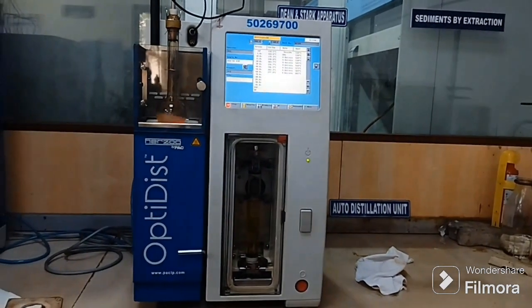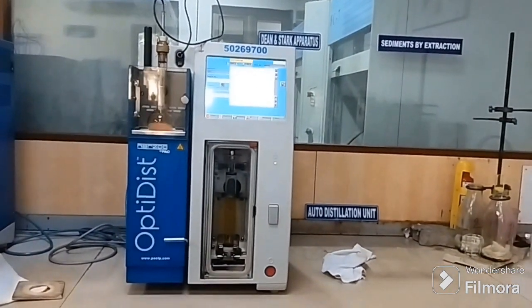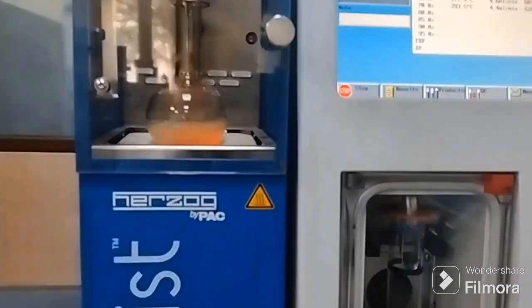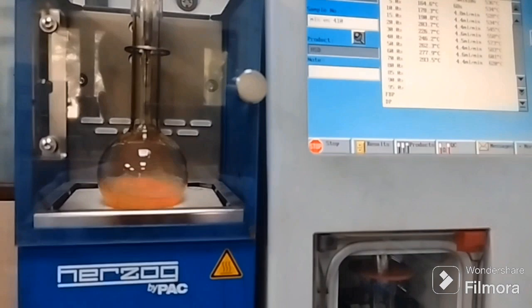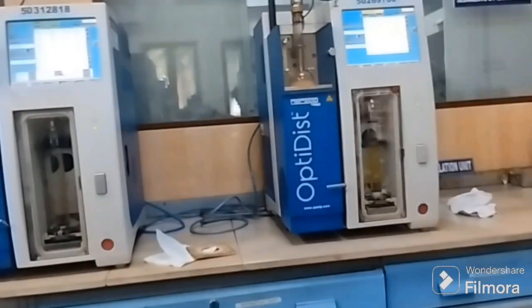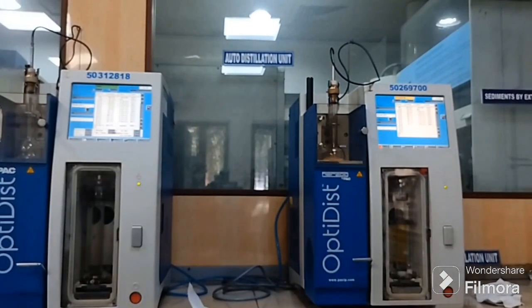The first drop, after condensation, drops into the cylindrical flask, and this upper sensor is going to sense the first droplet when it drops in this cylindrical flask, and what the corresponding temperature of the vapor is for this first drop, right? So that's all that we can see here. Further, I'm going to explain how all these things work, right?